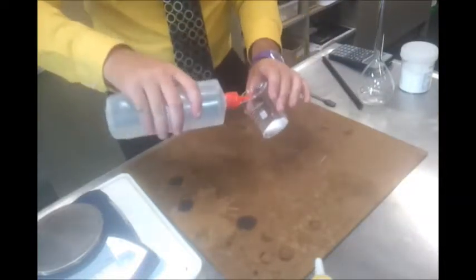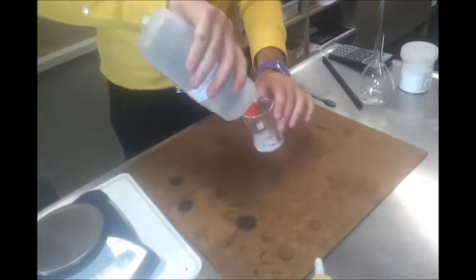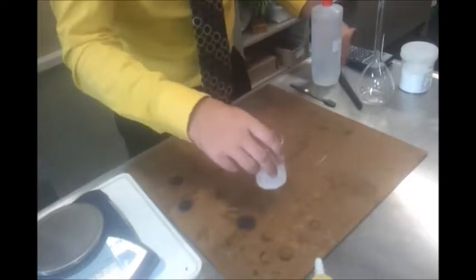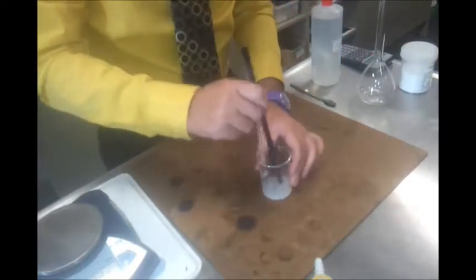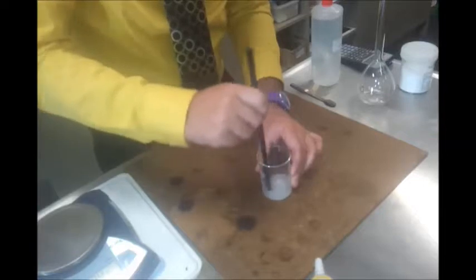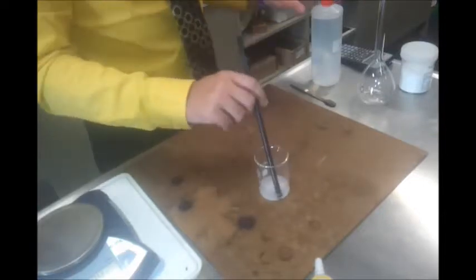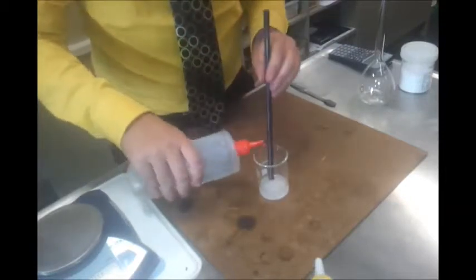Okay, so I need the mass that I did actually record. Then, you can see I just got rid of my stirring rod, which is poor planning. Then I'm going to put some distilled water in there. And you'll see it goes quite cloudy and quite clumpy, because a lot of the crystals are becoming hydrated, and some of them are dissolving. So what I'm doing here is basically trying to dissolve the crystal as best I can.